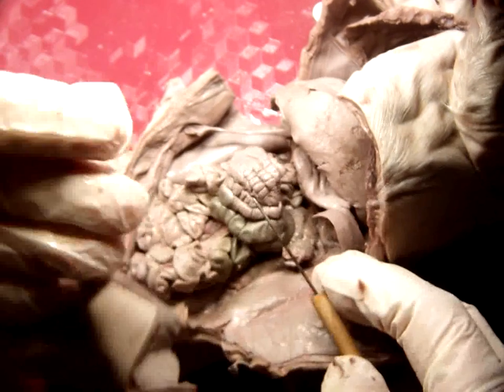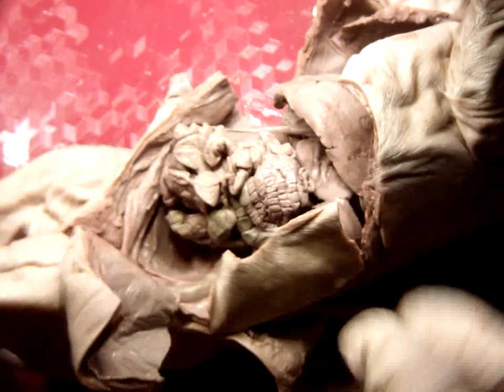Next on our list is rectum. A lot of people get rectum confused with anus. It's not the same thing. Anus are 2 sphincters, or round muscles, that open to allow things to pass and close to keep things from passing through. We have 2 anal sphincters, one internal that we don't control and one external that we do control.